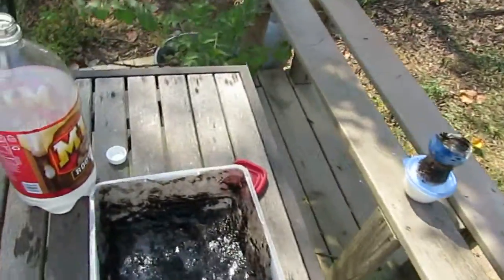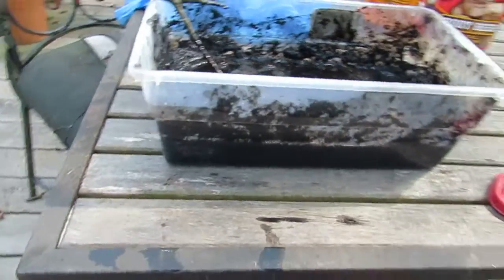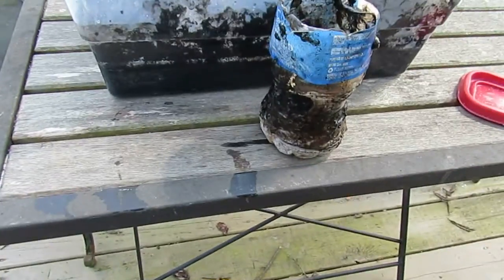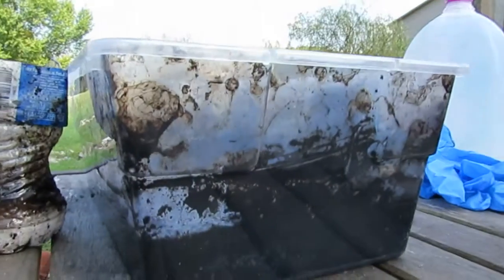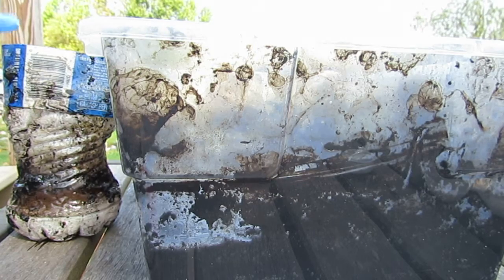It melted the thicker plastic. I got baking soda, about 13 pounds of it, and some distilled water to wash it out without reacting anything. I really didn't expect this — that's why I have this replacement container, because the original melted. See that little hole right there? Melted all the way through the plastic. Let me get a glove on — I brought like six pairs of gloves.